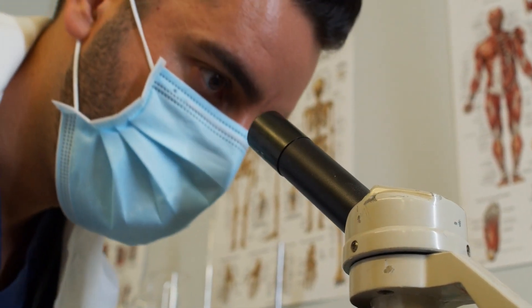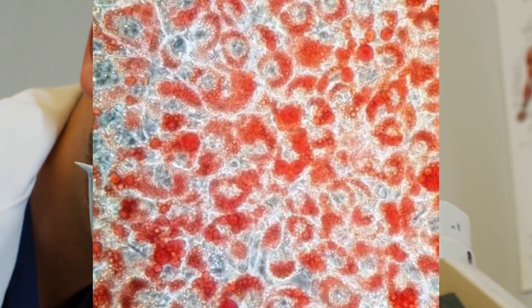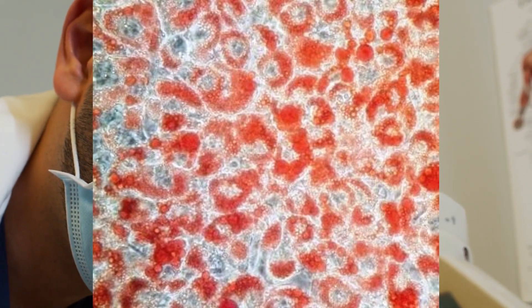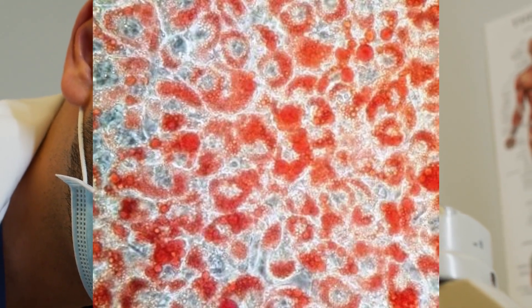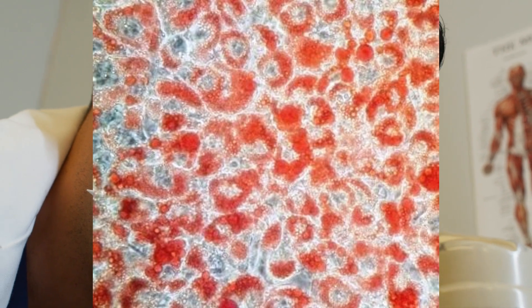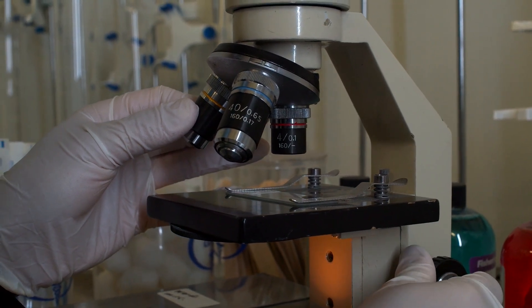Oil Red O is, in some ways, similar to Sudan Black. It's more frequently used largely because it is hydrophobic — it does not like water — and because of this, it will build up in fat more readily and more easily, allowing you to visualise what's happening. Because of its very distinct colouration, whether you use this or Sudan Black, you'll often be able to use automated software to more easily capture and analyse what's happening. This is particularly important in research where you want to compare different samples taken from different research groups.